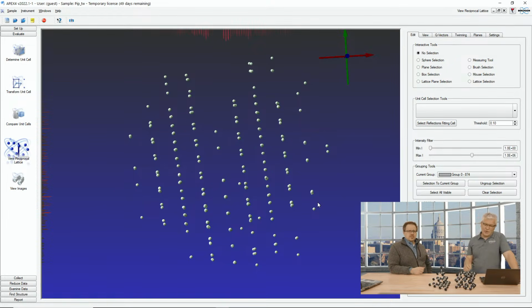And now what we have to do is find the right unit cell. Typically it's about deconvoluting the diffraction pattern. Okay, we have some tools here. You see, we were able to rotate this already. Now we'll show you two different methods to work with this.